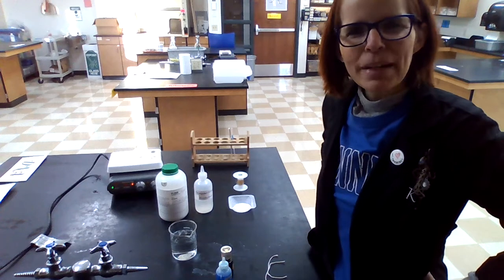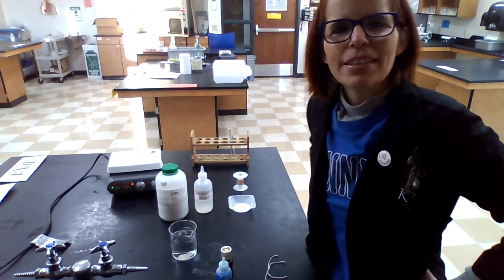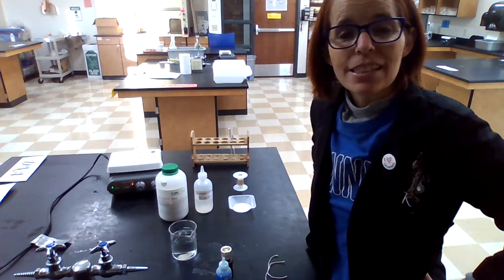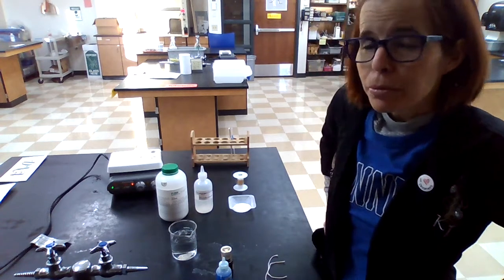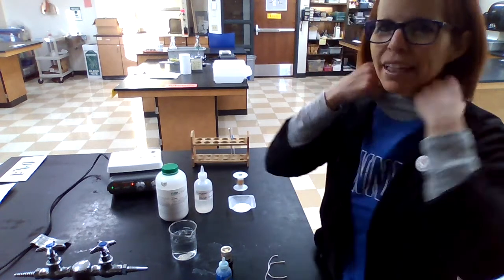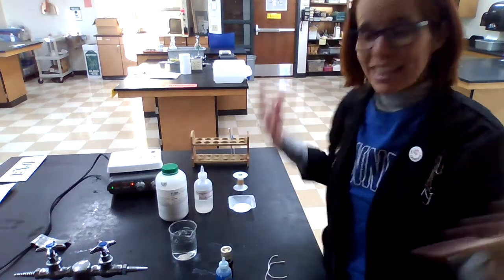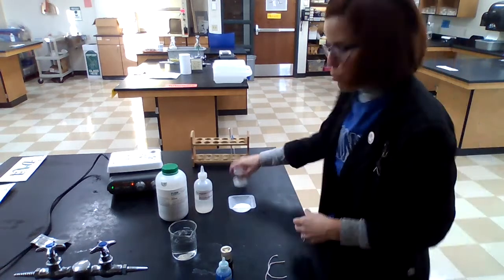Hi everybody, welcome to my lab. Today we're going to work on something called the semi-permeable membrane lab, also known as the baggy lab. Let's get started.